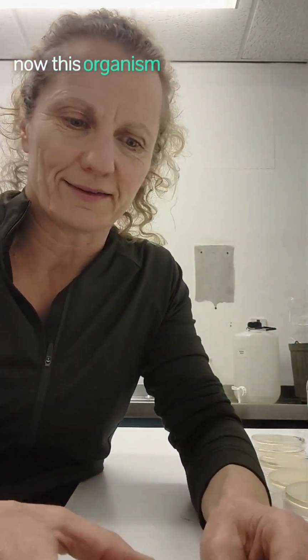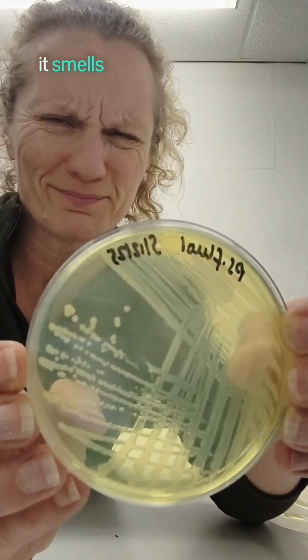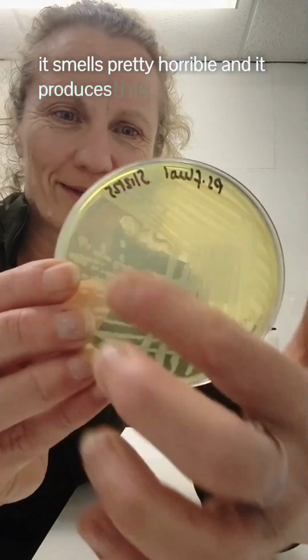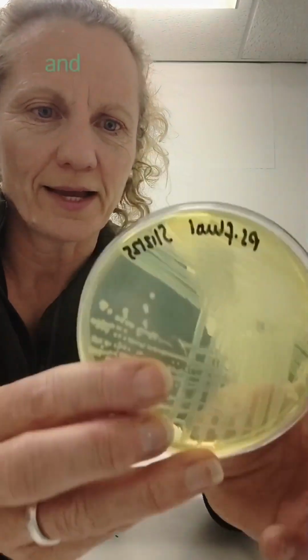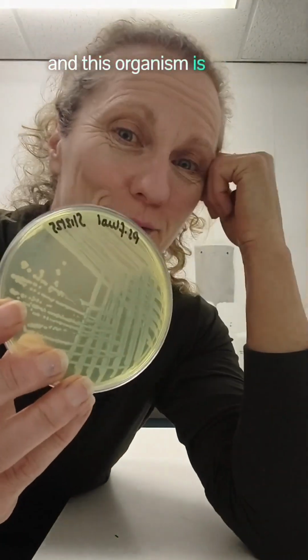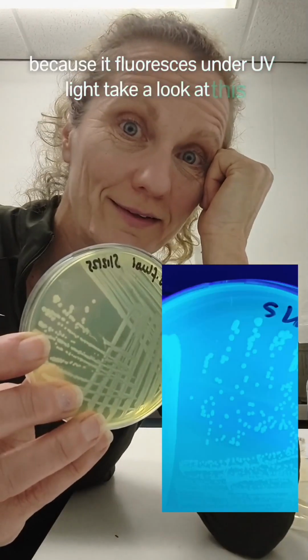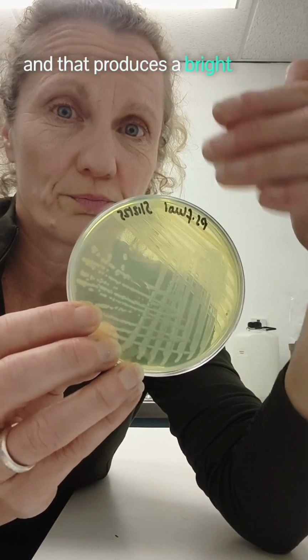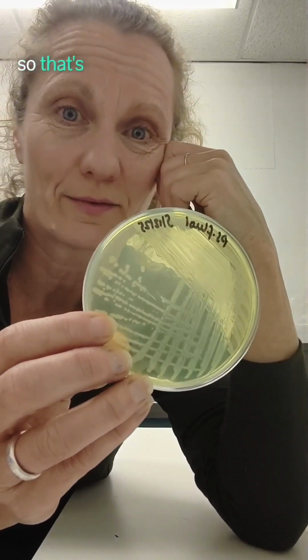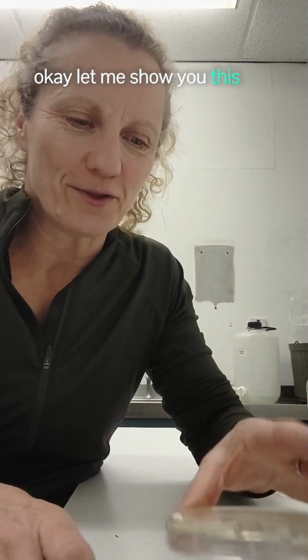Now, this organism is Pseudomonas fluorescens, and this is lovely. It smells pretty horrible, and it produces this yellow pigment. Can you see there's yellow going throughout this agar? And this organism is called Pseudomonas fluorescens because it fluoresces under UV light. Take a look at this. There is a pathogenic Pseudomonas called Pseudomonas aeruginosa, and that produces a bright green pigment in the agar. So that's really clear when you see it. You can't mistake that.